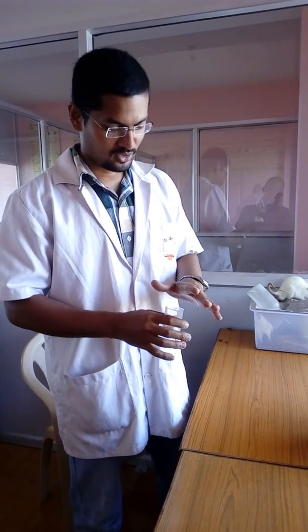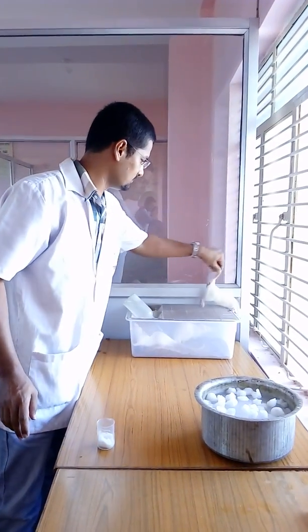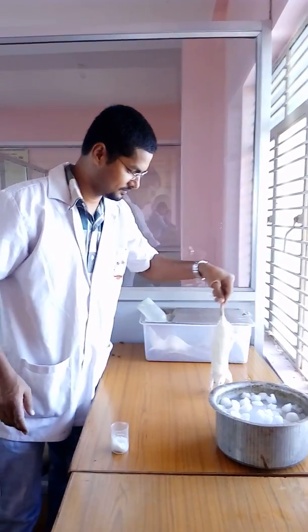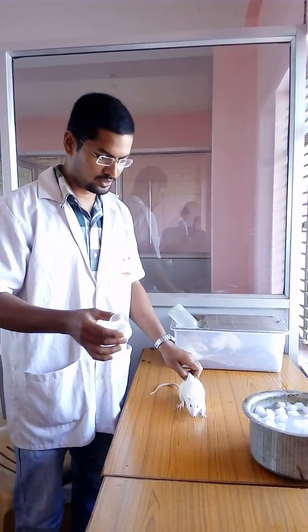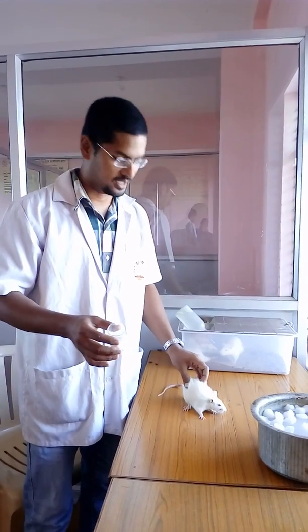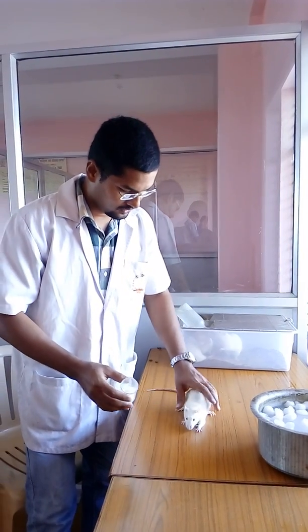Hi friends, this is Ravi Raza Pradhan from the Department of Pharmacology. Today we are going to show you how to anesthetize a rat and perform a retroorbital blood collection. We are using inhalation anesthesia here, though you can also use pentobarbital sodium or ketamine hydrochloride.